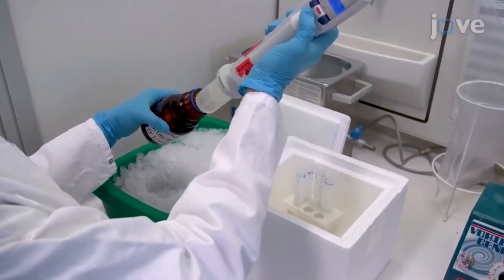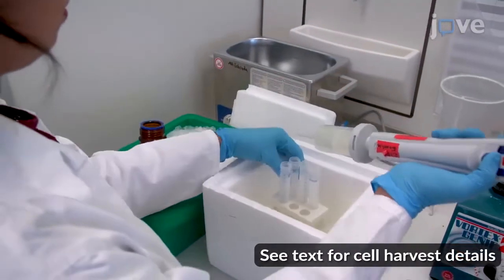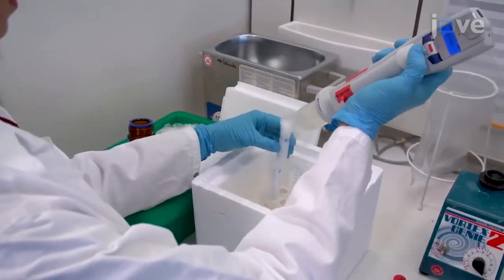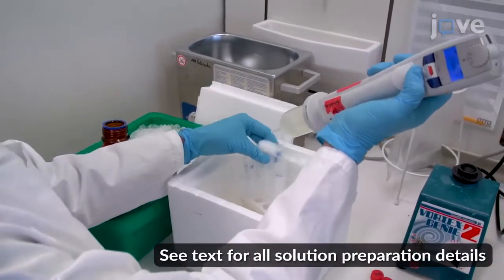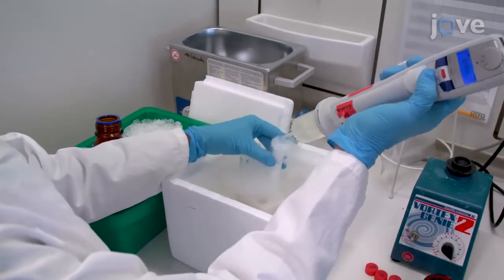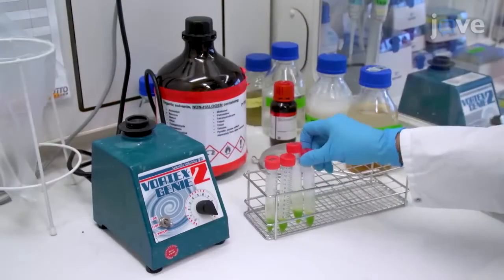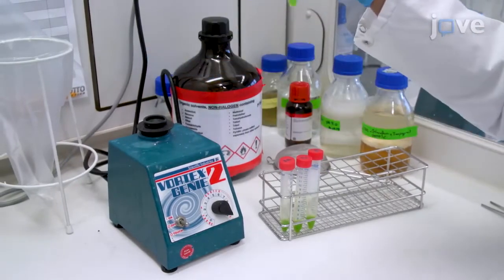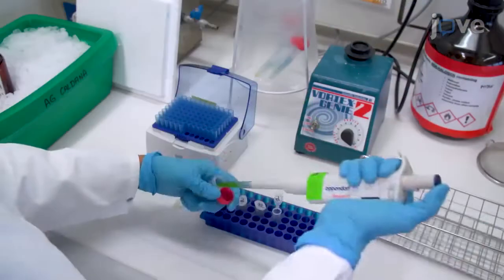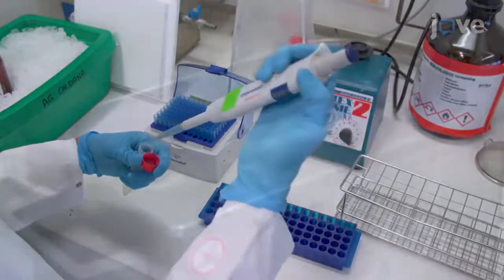For chlorophyll, lipid, and metabolite extraction, arrange the tubes of harvested Chlamydomonas cell pellets in liquid nitrogen. Resuspend the pellet in each tube with 1 milliliter of -20° extraction buffer 1. To avoid evaporation of the low-viscosity extraction buffer, quickly vortex the tubes until the cells are well homogenized within the extraction mixture, and aliquot the solution into 2 milliliter microcentrifuge tubes.